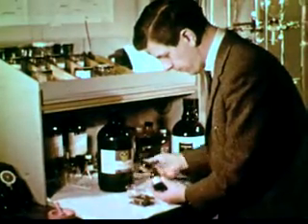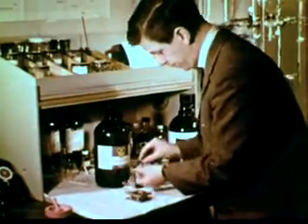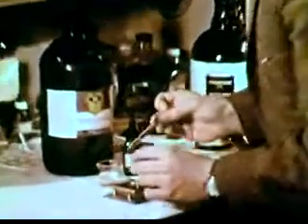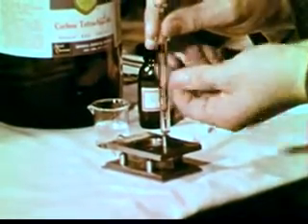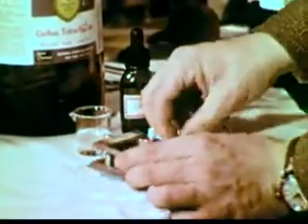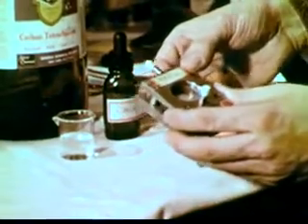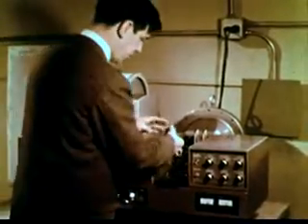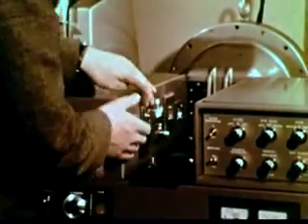If we contaminate a carbon tetrachloride sample with a small amount of chloroform, it's a simple matter to put some of the sample in a small cell and measure its infrared spectrum. The spectrum of the mixture will show not only the characteristic features of the predominant carbon tetrachloride, but also those of chloroform.